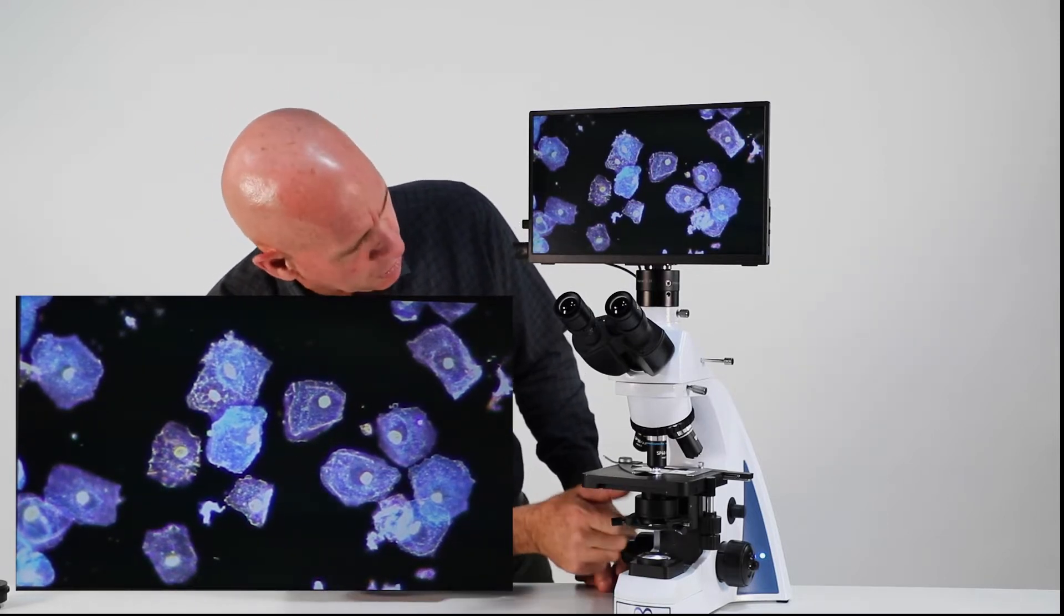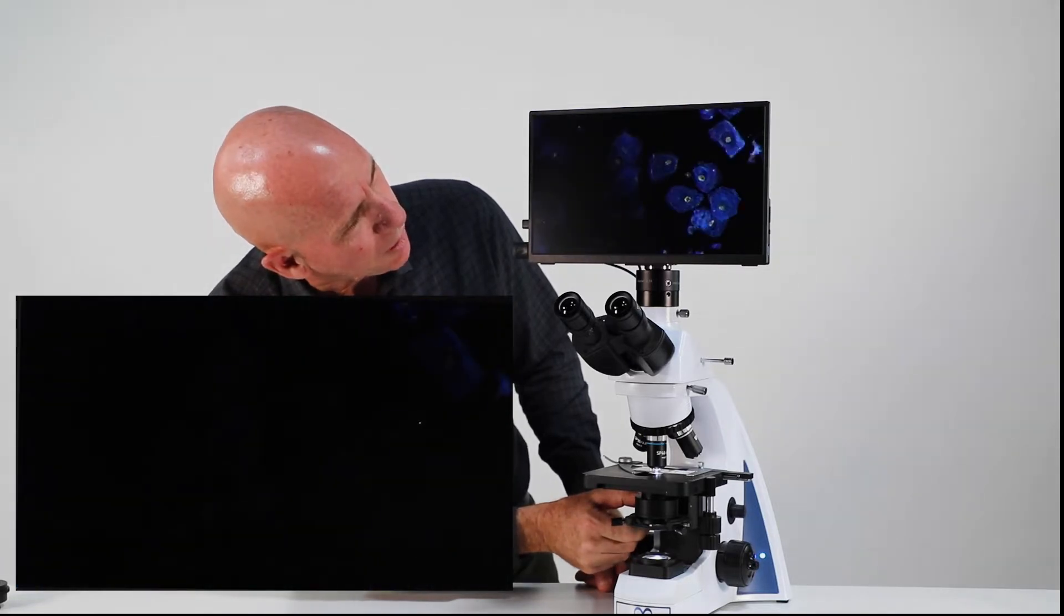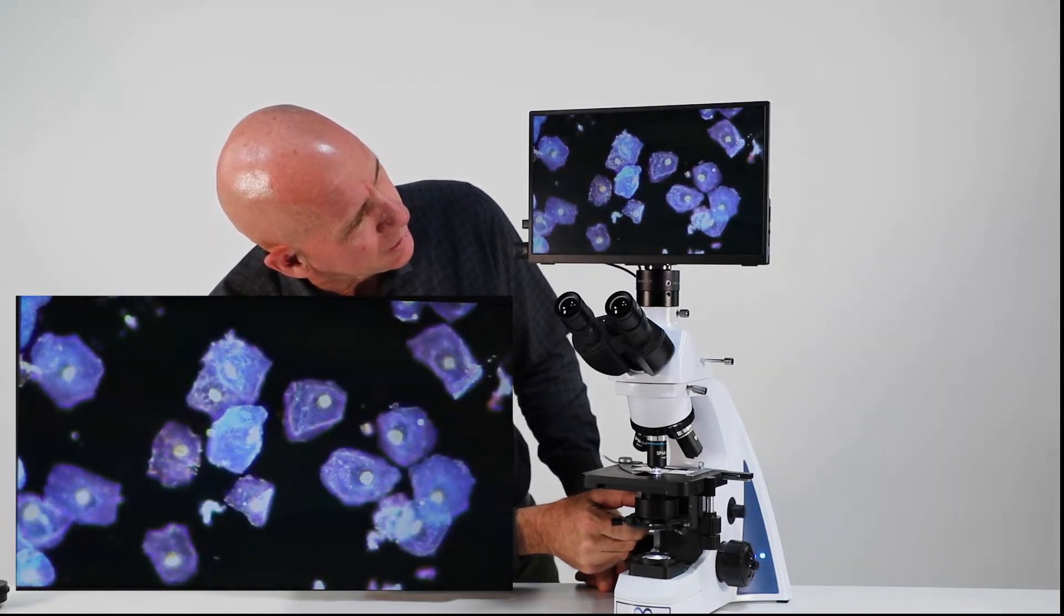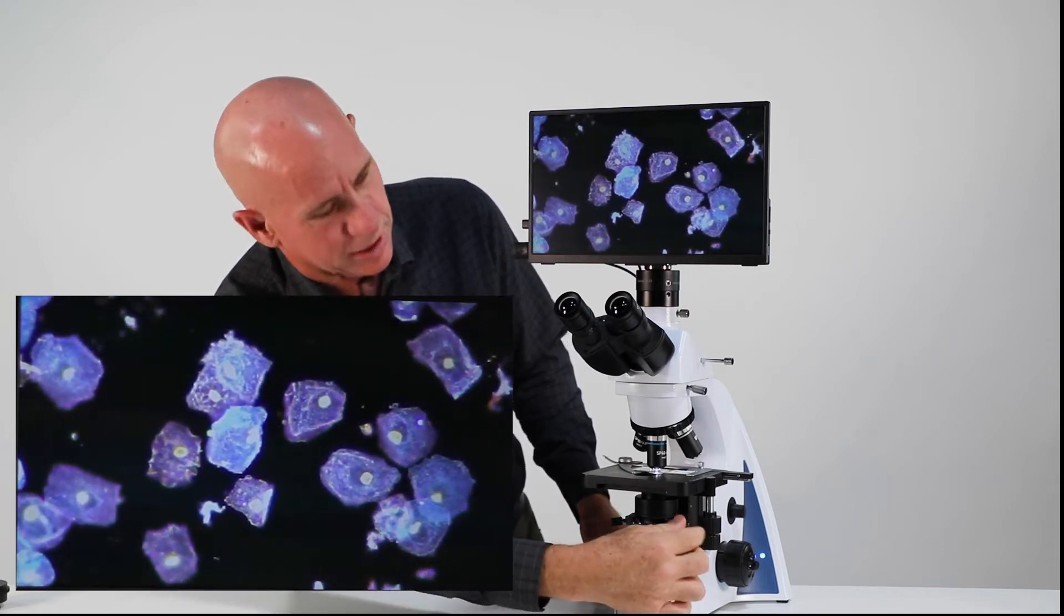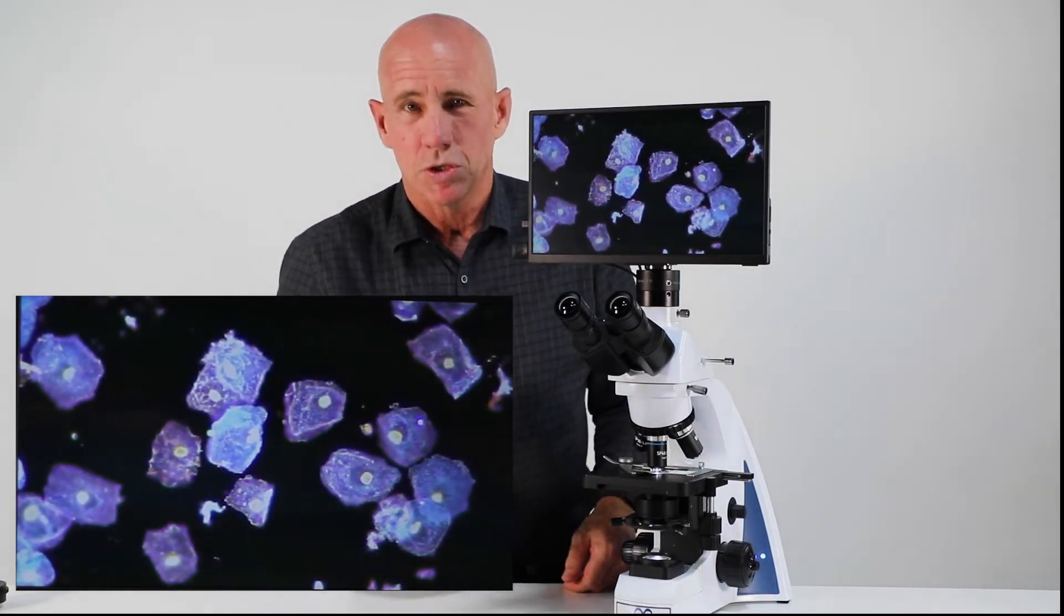But again, I'm going to go up and down a tad. So I lost it. Come back in and I can go down, find just the best spot and make sure you're aligned. But again, I do the alignment usually on the 4X.